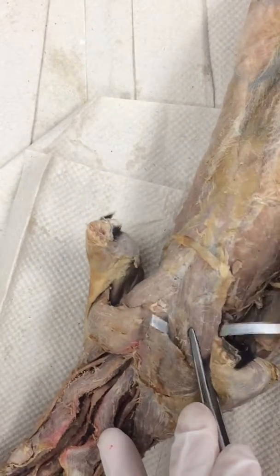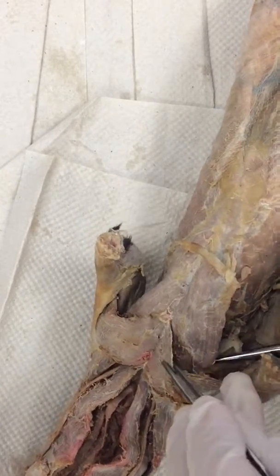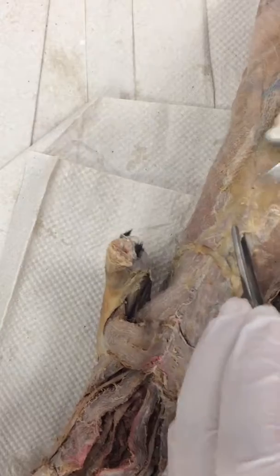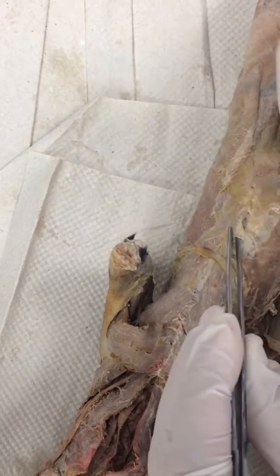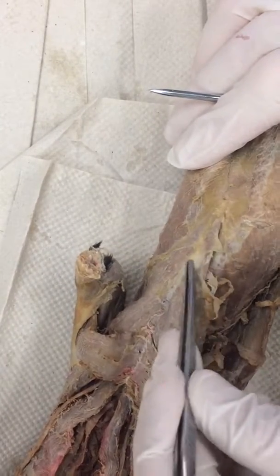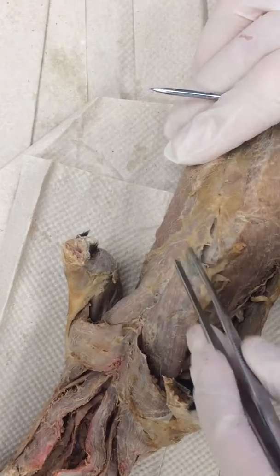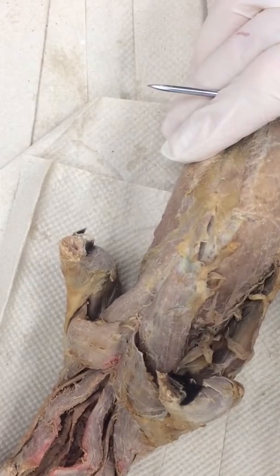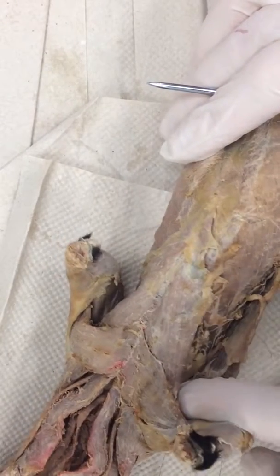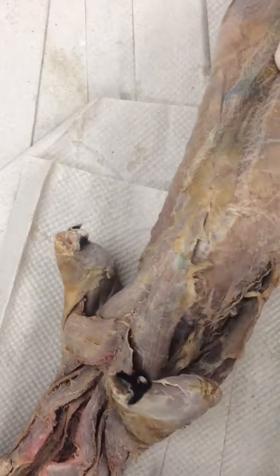You can see I'll come right through on the other side, right underneath major. Now we just want to clean this all the way down to where it hits the sternum. There's a lot of connective tissue here, and then that muscle is done. Off camera I'm going to come in and clean all this fat off so the muscle looks nice and tidy. Any questions? Remember: get latissimus dorsi off first, all the way up into the armpit, and then do the bottom of minor until you come up underneath major. Ready, set, go.